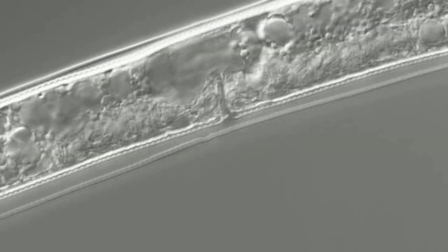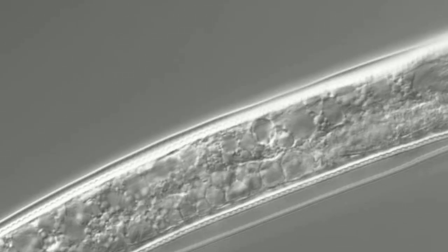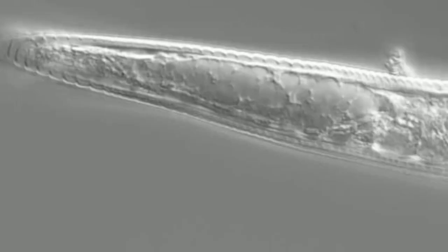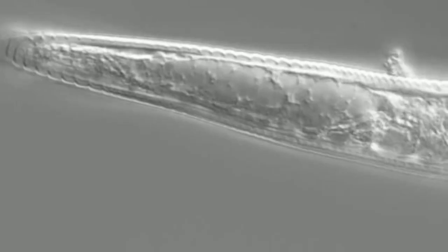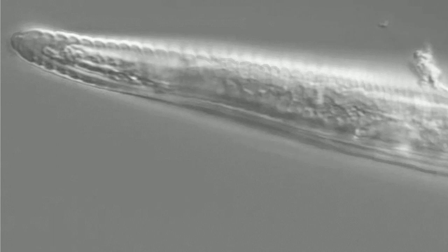When we go posteriorly past the vulva, we are seeing the posterior branch of the reproductive system of this nematode. At last, we have come to the posterior end of this nematode, and here we are seeing the tail, which is bluntly pointed and hemispherical in shape.